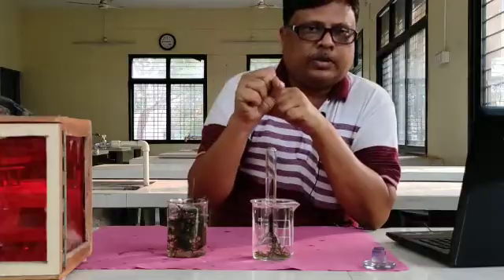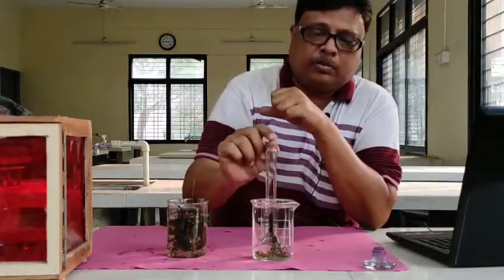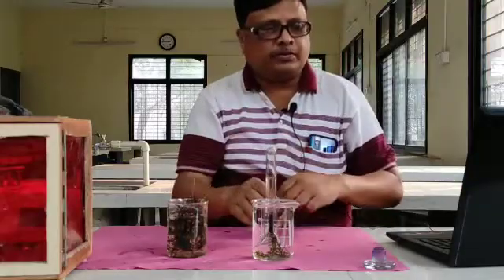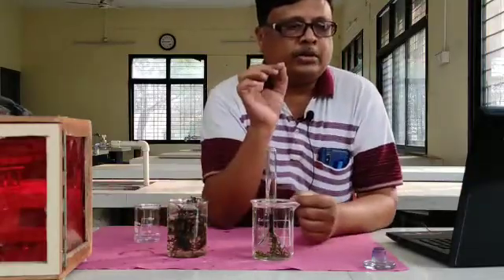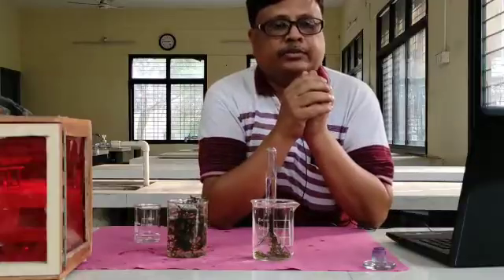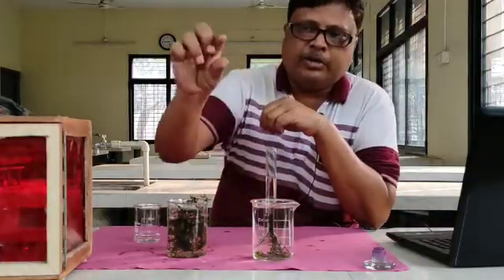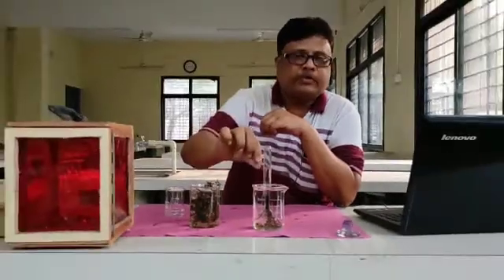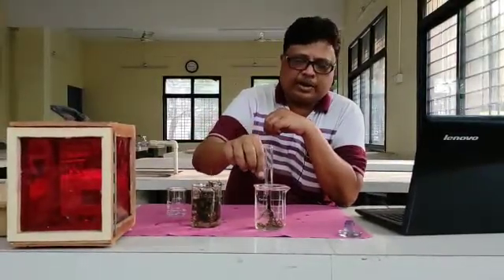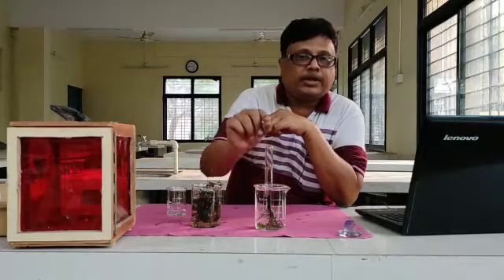That is the evolution of oxygen. CO2 is absorbed and O2 is released, so the bubbles you are observing are of oxygen. The first experiment is to determine the effect of CO2 concentration. For that, we are using sodium bicarbonate. I will use sodium bicarbonate one by one. When I add 1 gram of sodium bicarbonate, the rate of photosynthesis will be higher.